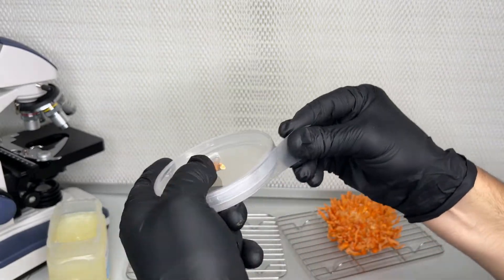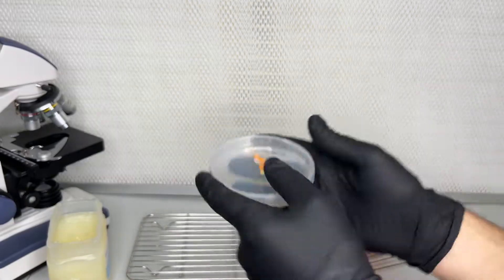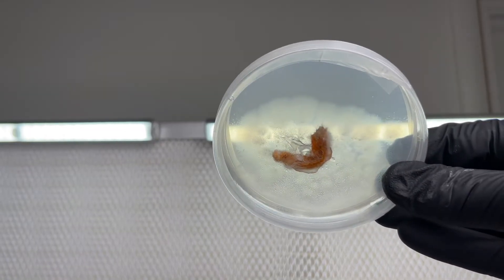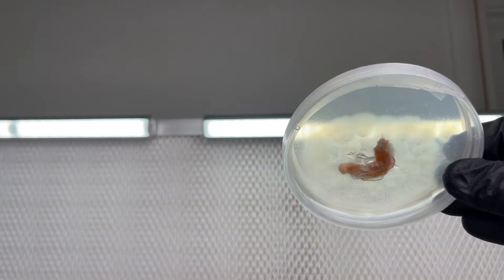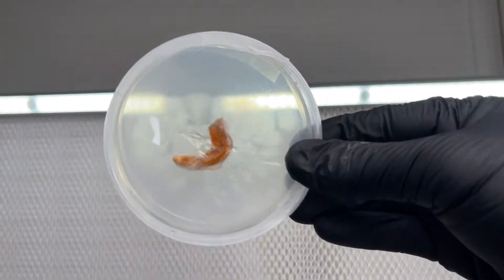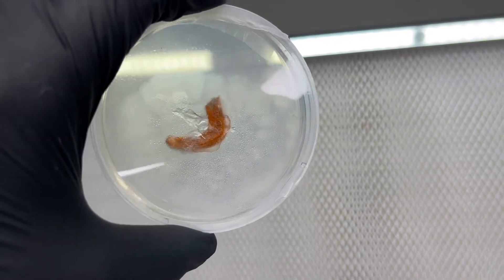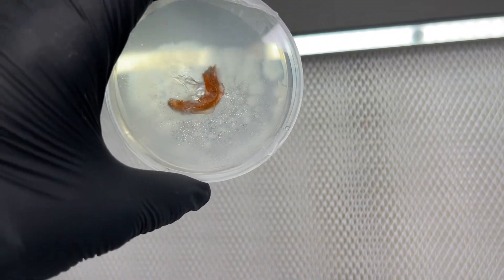After observing the plate for two weeks while it's incubating, you will start to see the zones of mycelium on the leading edge are very uniform and most likely dikaryotic. A sterilized scalpel is used to transfer a piece of the leading edge into liquid culture media.